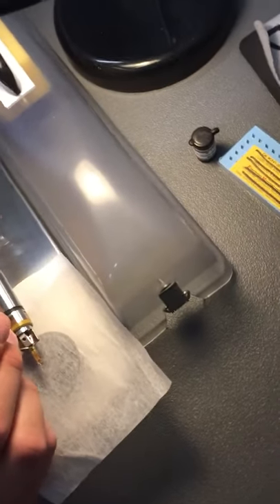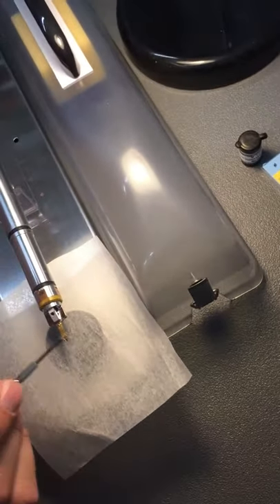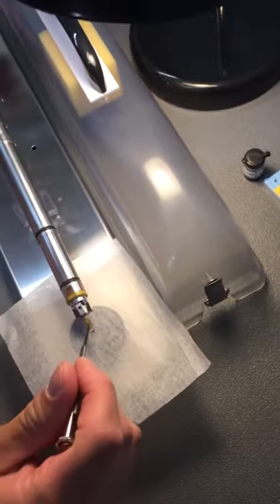There's a tiny little screw, so I have a tiny little screwdriver. One of the things you want to make sure — don't turn it too far, because then the screw will pop out and be really difficult to put back on.